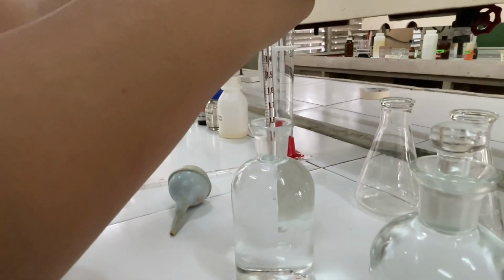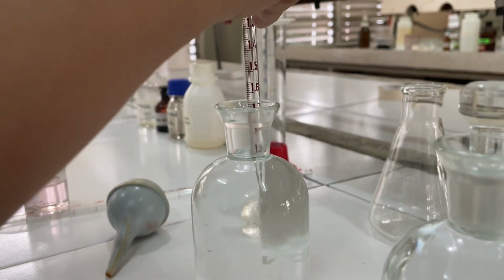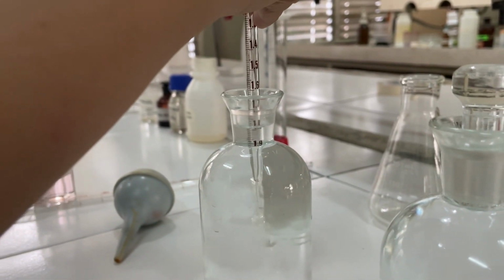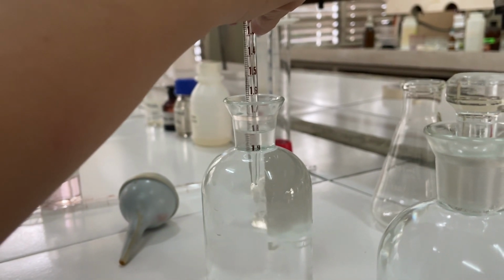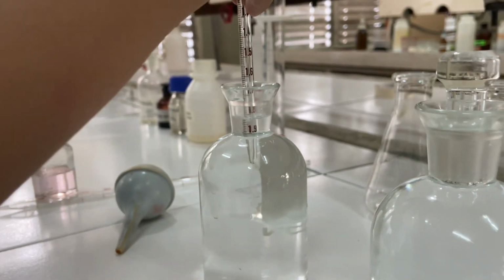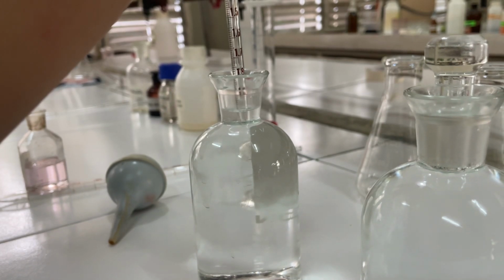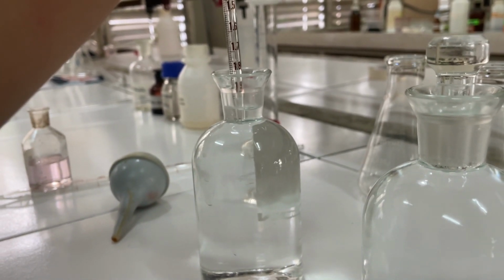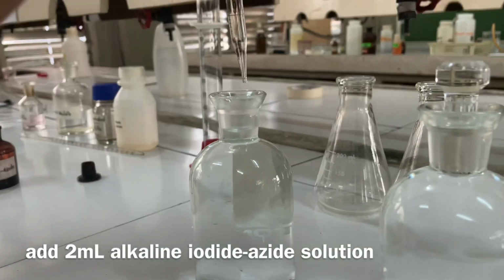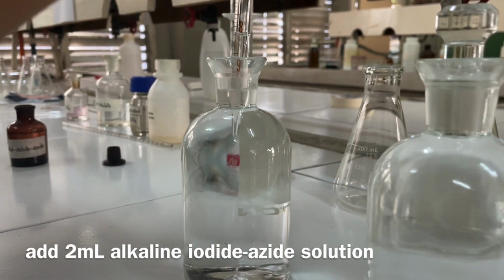Immediately add 2 milliliters of the manganese sulfate solution to the collection bottle by inserting a calibrated pipette just below the surface of the water sample in each BOD bottle. Squeeze the pipette slowly so no bubbles are introduced via the pipette. If the reagent is added above the sample surface, you will introduce oxygen into the sample. Add 2 milliliters of the alkaline iodide azide reagent in the same manner in each BOD bottle.